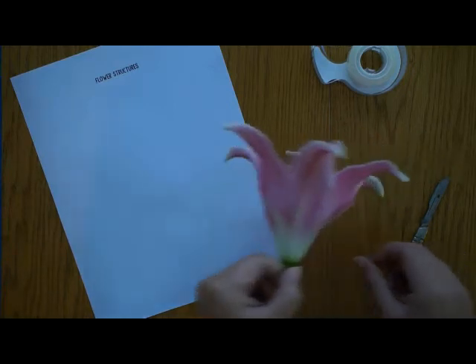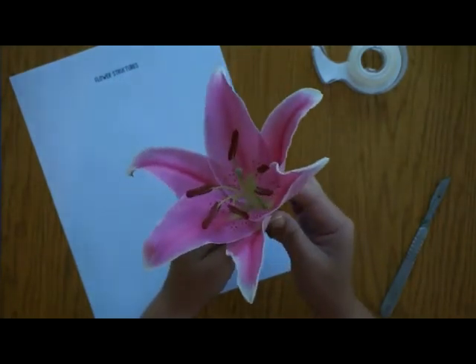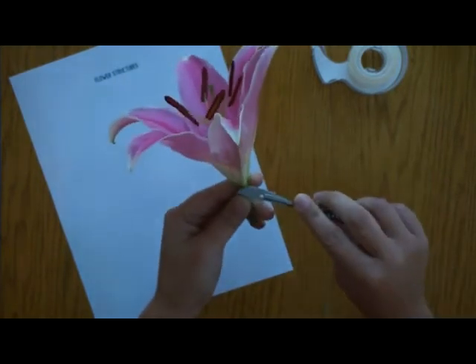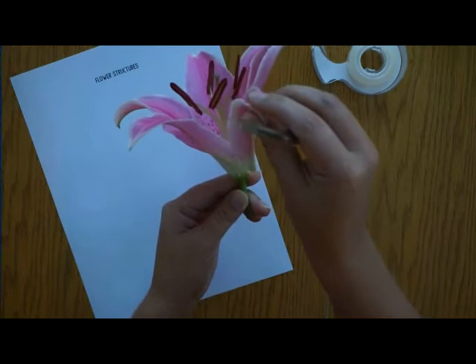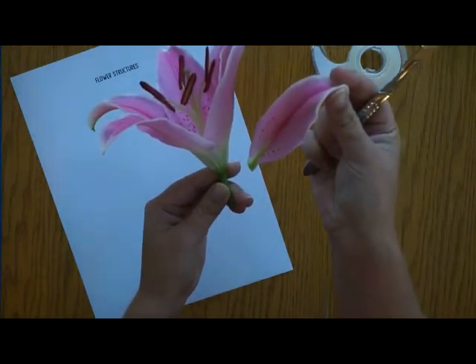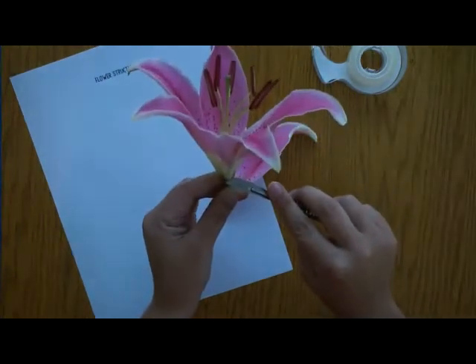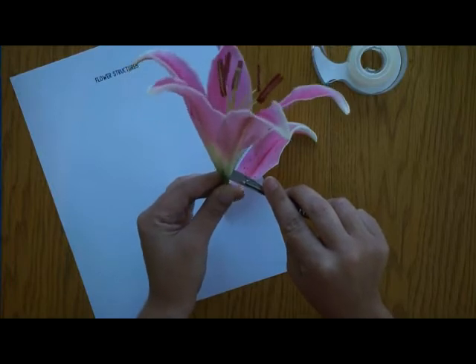The first thing you're going to do, according to your procedures, is to cut off your sepals. Sepals are usually green, but on lilies they are not. They are those outside petal-looking structures, and there are three of them on a lily. Because they look so much like petals, they're actually called tepals instead of sepals. There are a couple of different plants that have this, and we're going to cut them off and consider them as sepals.